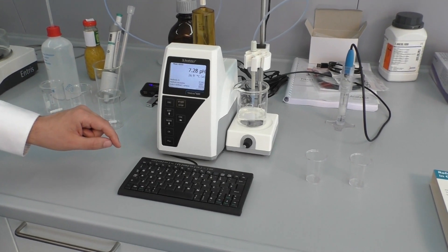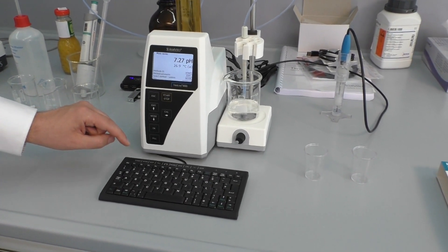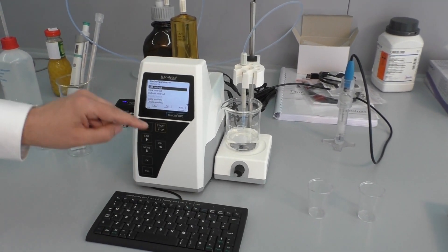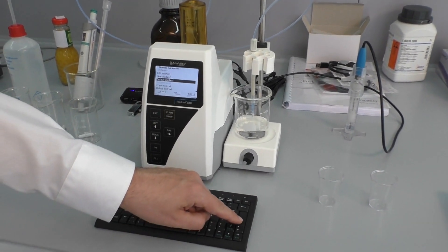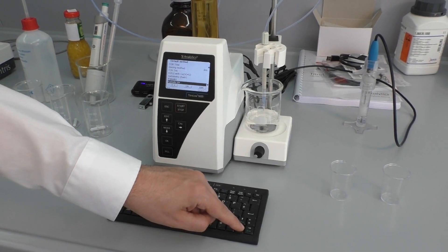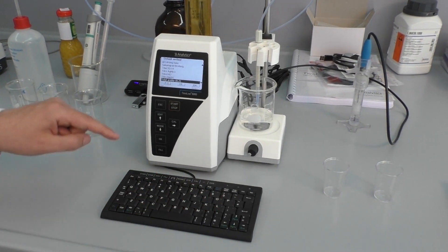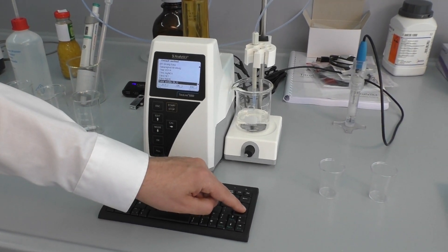Now we can select the method to be used from the standard methods. Therefore we go to Edit, then Default Methods, and here the method "Total Acidity to pH 8.2" is the right method.